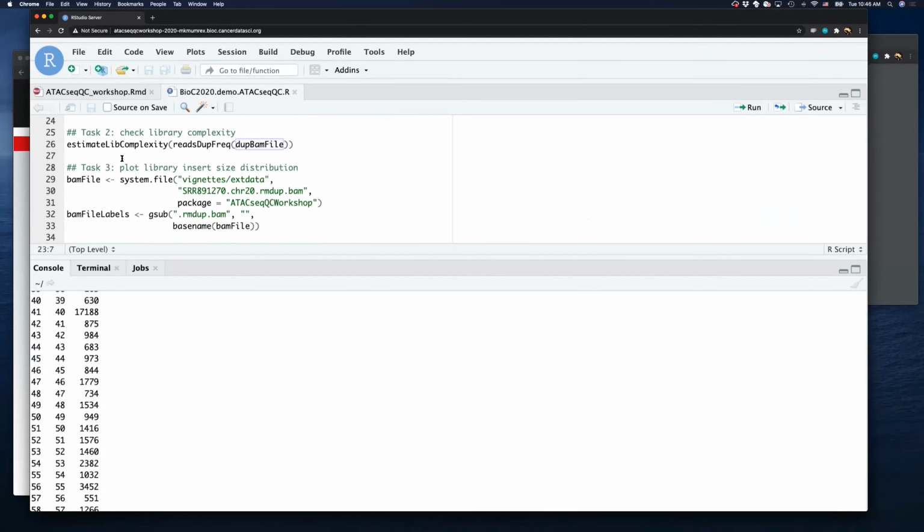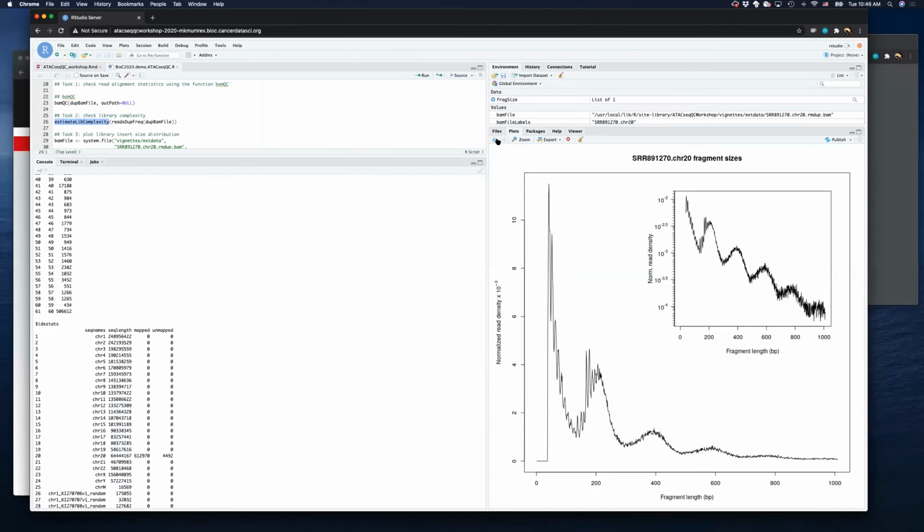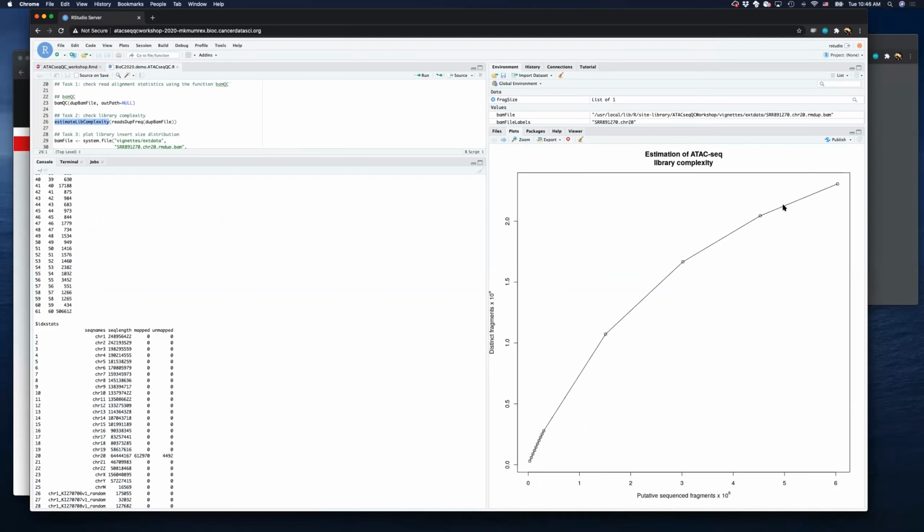We already ran the bamQC. It just tells you the basic information about your BAM file. The next step is we check library complexity. It's called estimateLibComplexity, and you can see the plot looks like this. The x-axis is a subsample of the fragments. The y-axis is the unique, distinct fragments.